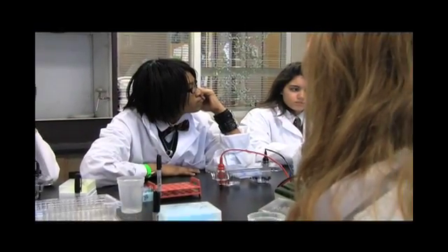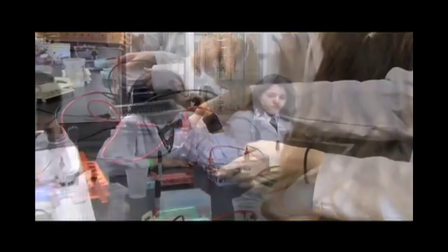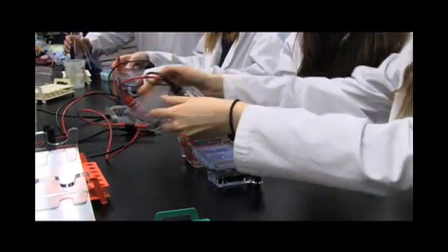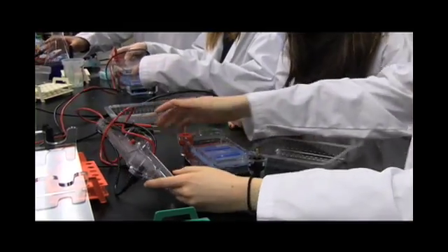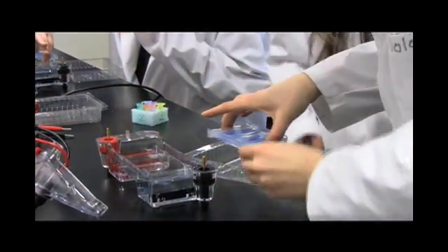After 20 minutes, we will disconnect the power supply, open these boxes, and pull the gel box out.